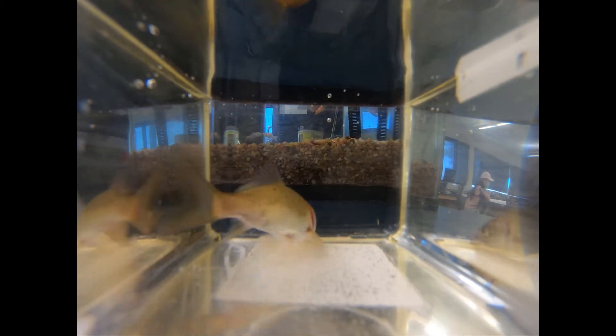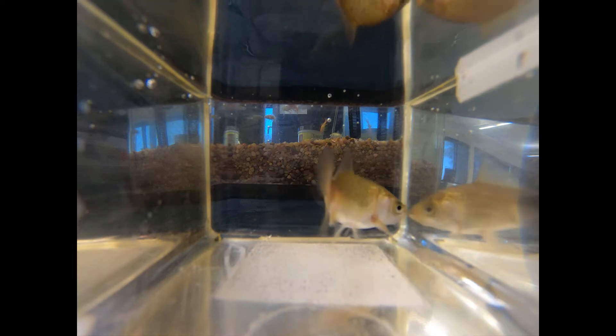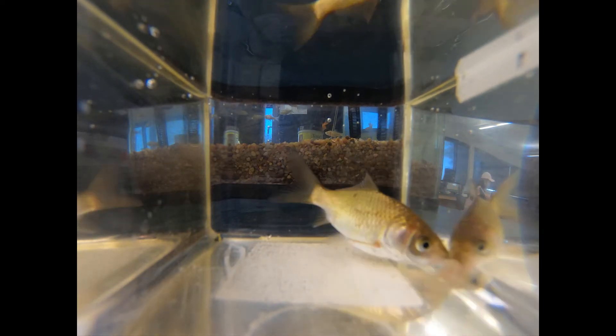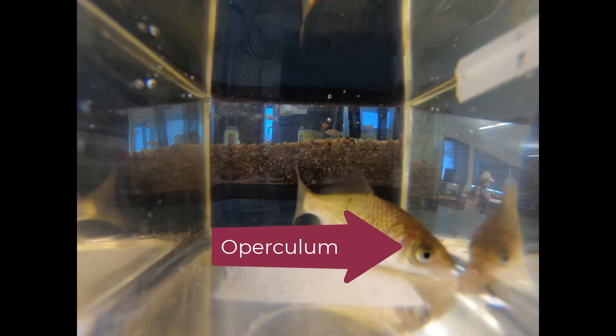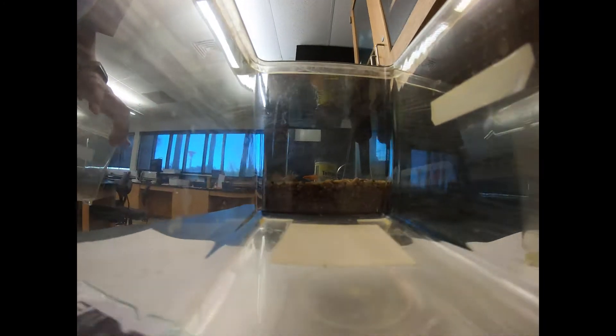Today we're looking at metabolic rate in the goldfish. We need to count operculum movements — the operculum is located here on our goldfish and it covers the gills. When the operculum moves, water is passing over the gills, giving us an idea about how fast the goldfish is breathing in the water.